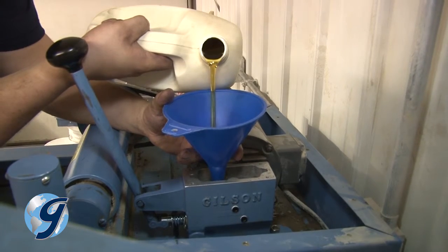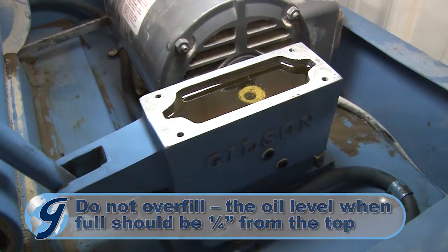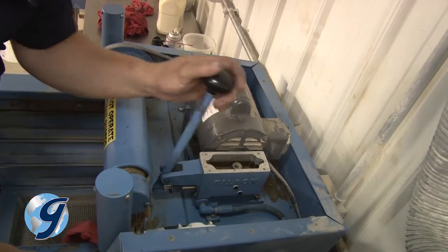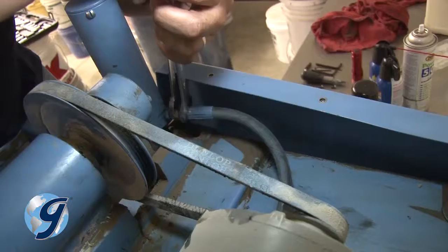Now, refill the pump with hydraulic oil, and take care not to overfill. The oil level when full should be 1/4 inch from the top. Now bleed the hydraulic lines by working the handle on the pump as if we were clamping the screen trays. Observe the hoses at the cylinder fittings, and as soon as fluid appears, tighten the fittings.